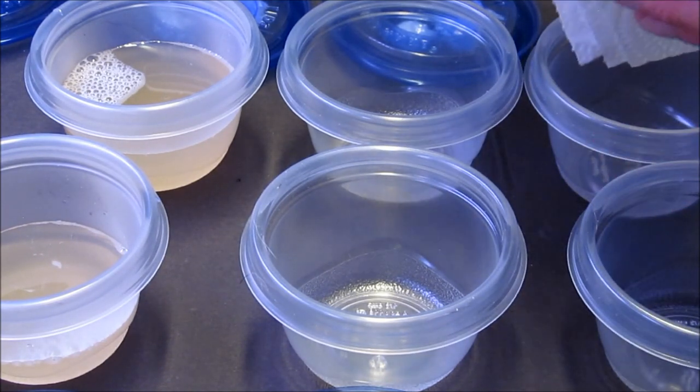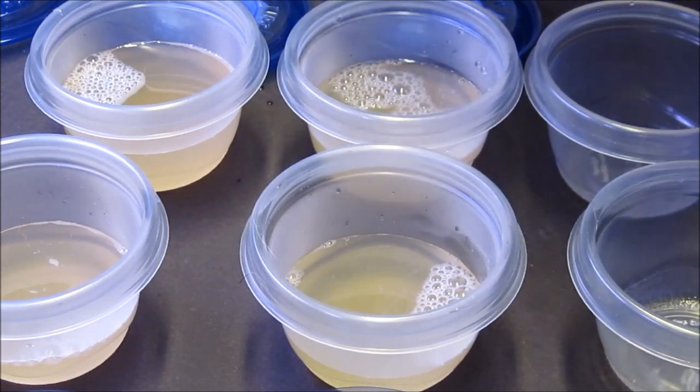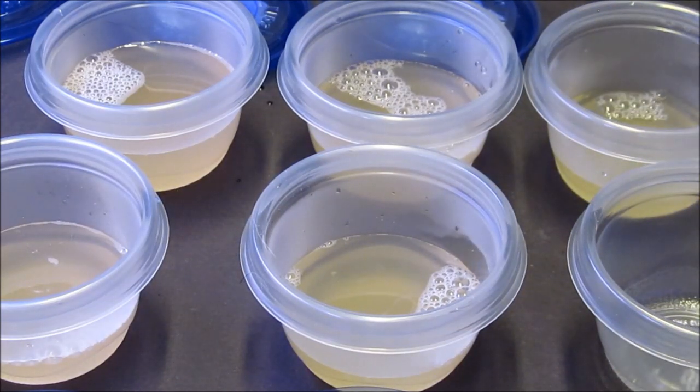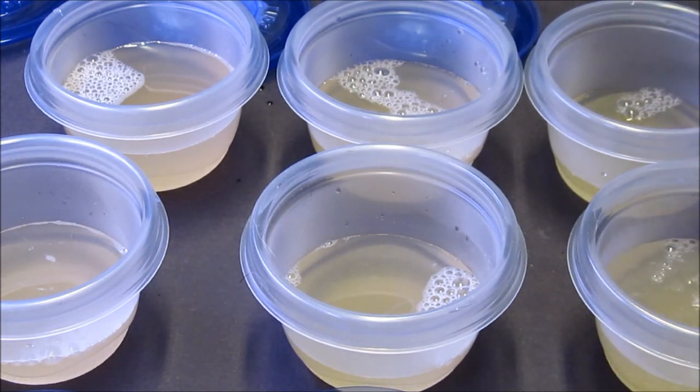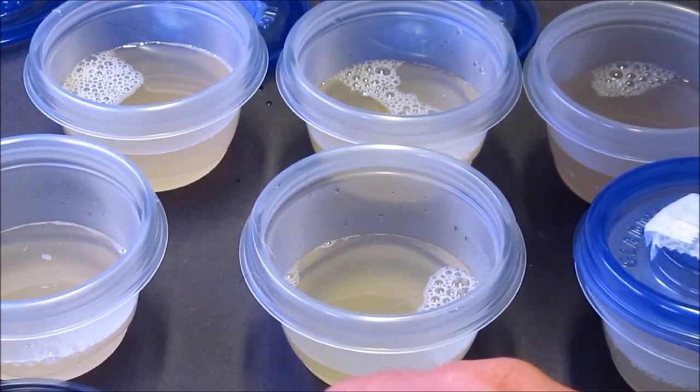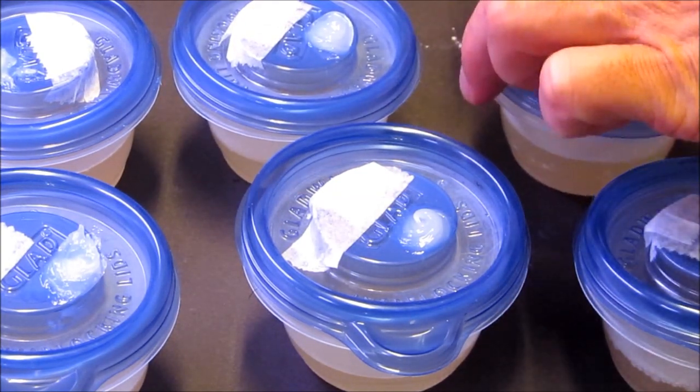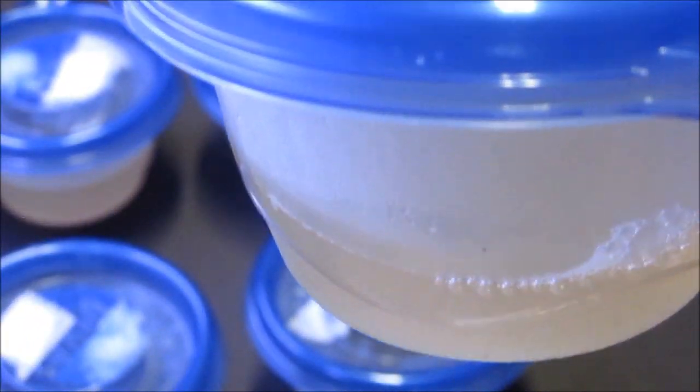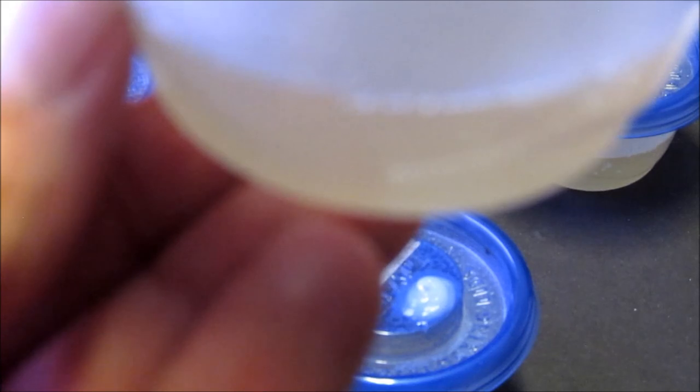More is not necessarily better because you just want a thin layer on the bottom. That's all there really is to it. Put those on and show you how we're going to wrap them up. I know it's a little hard to see and I don't want to tilt it too much, but you can see that there's only a small fraction of that Glad mini round that's full. Do not fill it all the way up, just one little thin layer in the bottom.